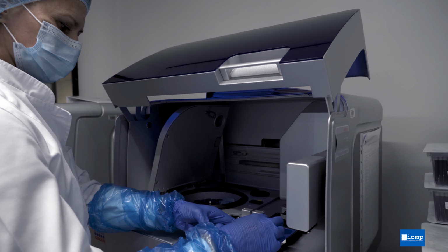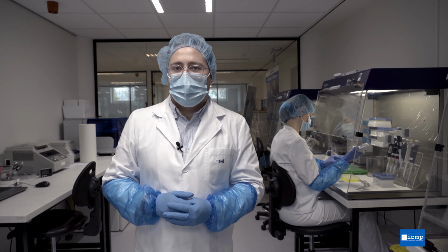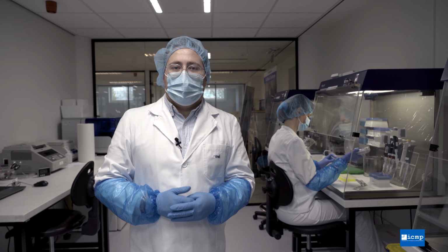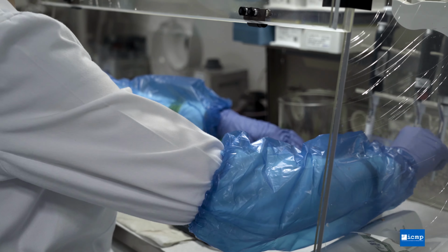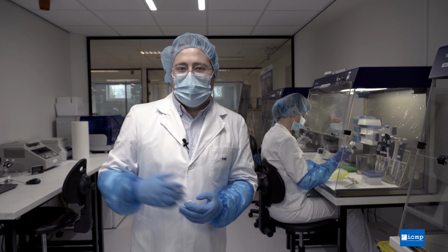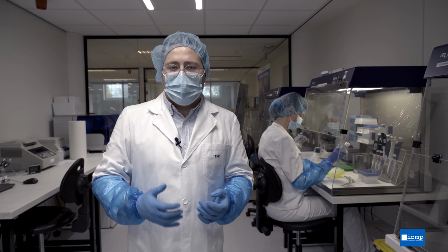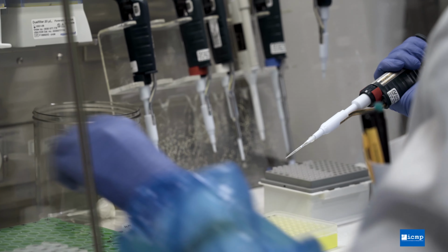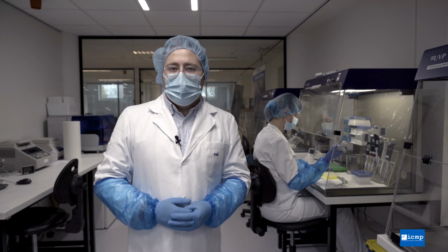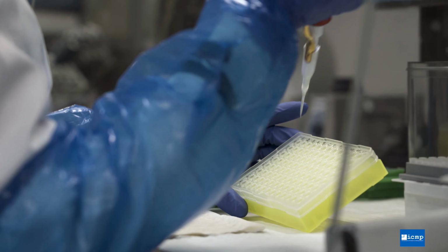Once we have obtained a pure DNA extract in the previous laboratory, we must first determine how much DNA is present in each sample. We call this process quantification. Also in this laboratory, we prepare our samples for downstream processing. In this process, we copy or amplify the DNA in our sample. We create millions of copies of the fragments of DNA that we're interested in analyzing. This process works in a similar way to a photocopier. This process is known as PCR.